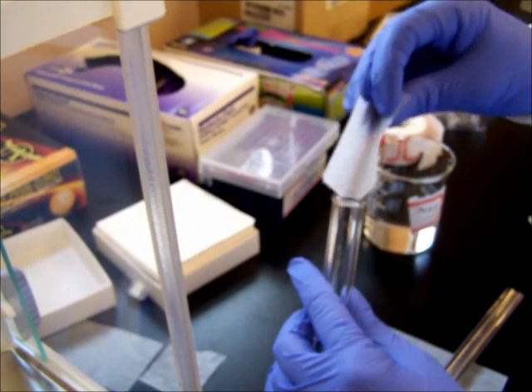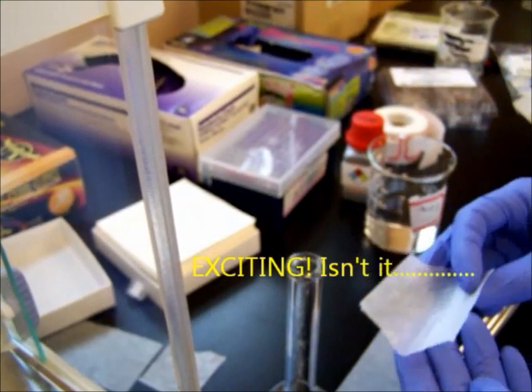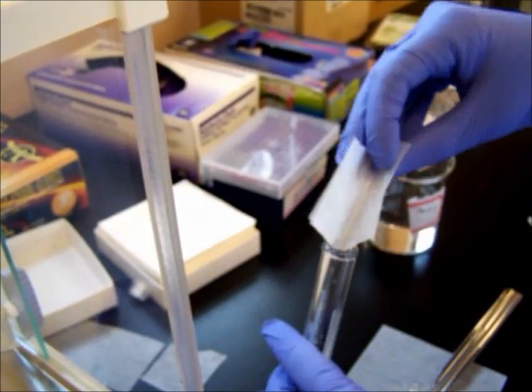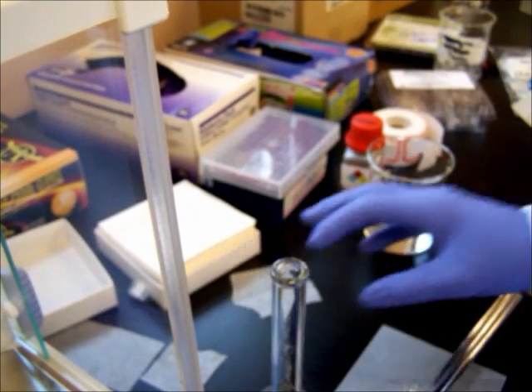And get as much as possible into the volumetric flask. It's never going to be perfect, but it's about as close as we can get for our purposes.